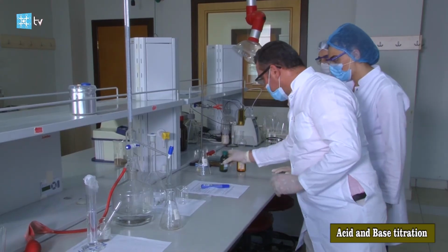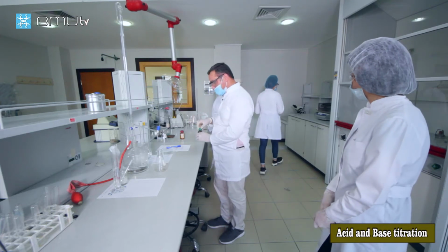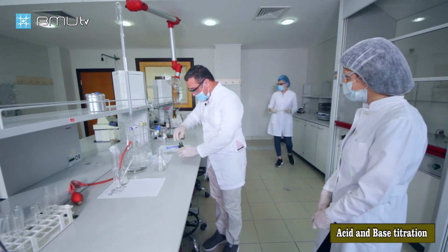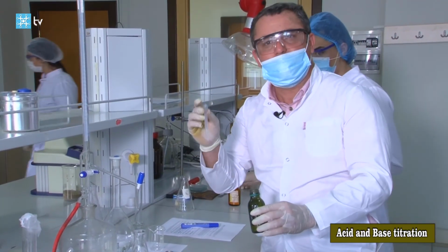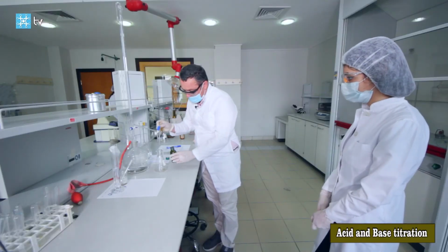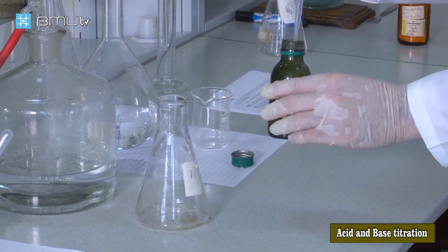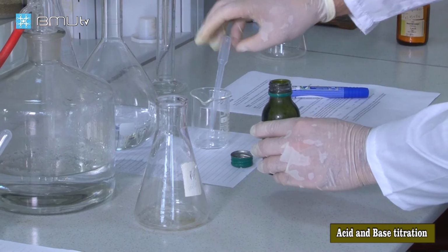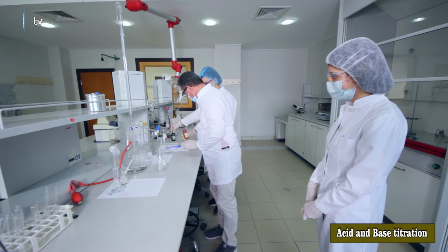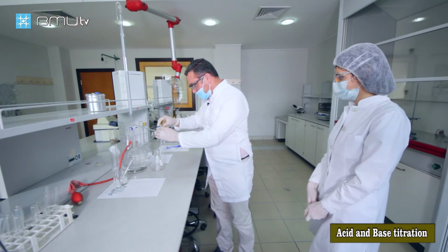Now we must add a few drops of the indicator. Where is the dropper? Please give me the dropper. Our dropper is here. 1, 2, 3, 4. Enough. Now this indicator is enough, and let's start the reaction.